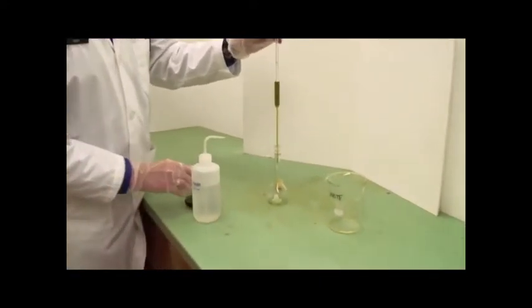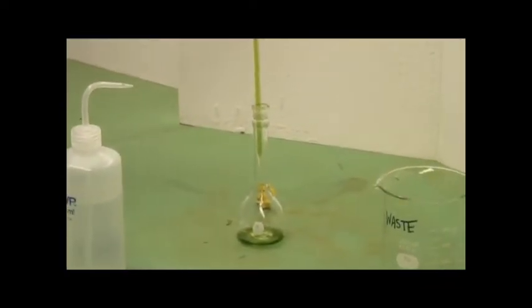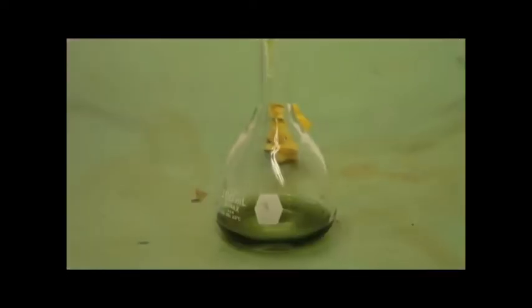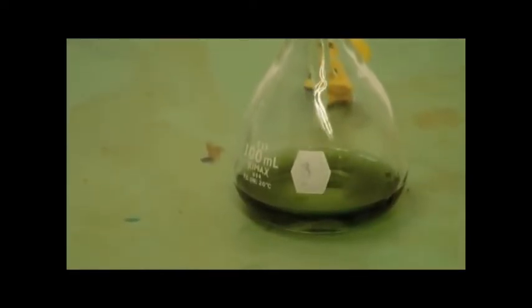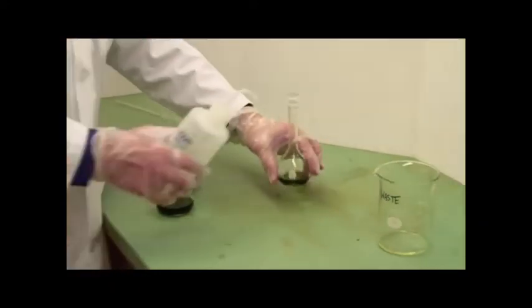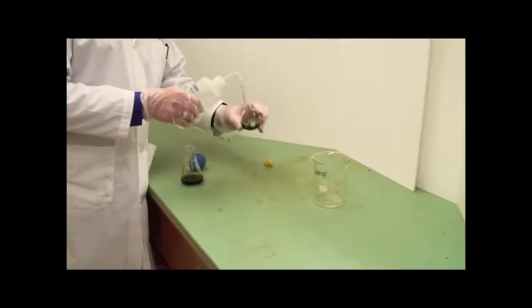And again, we allow this to dispense directly into the volumetric flask this time. And resist the temptation to use the bulb to speed the process up. Once it has stopped, and you've counted 10, touch the tip of the pipette to release it, and away we go. Now at this point, use your distilled water bottle to wash down the sides, and we'll be adding.